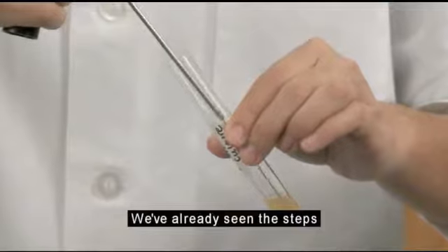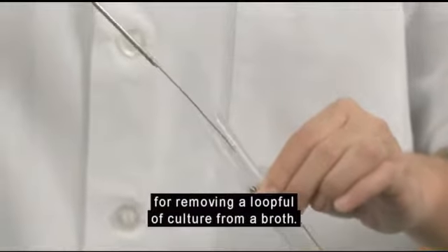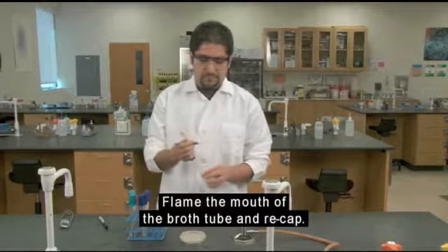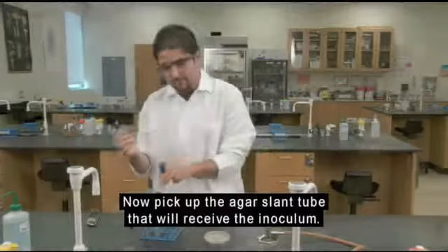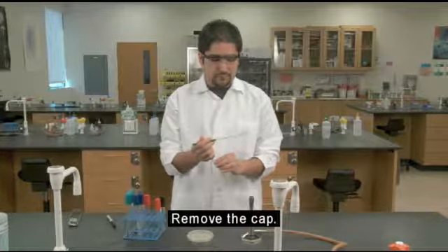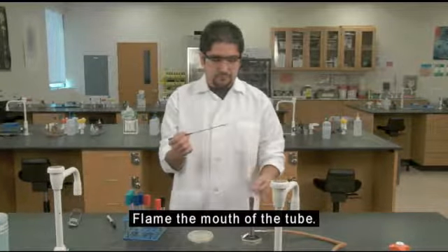We've already seen the steps for removing a loop full of culture from a broth. Flame the mouth of the broth tube and recap. Return it to the test tube rack. Now pick up the agar slant tube that will receive the inoculum. Remove the cap. Flame the mouth of the tube.